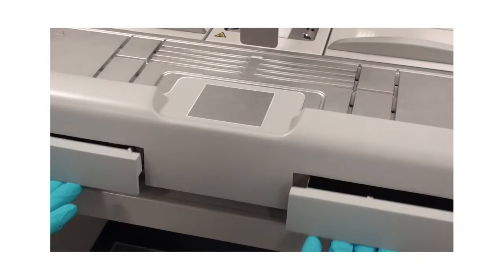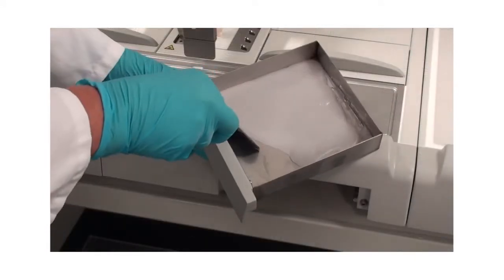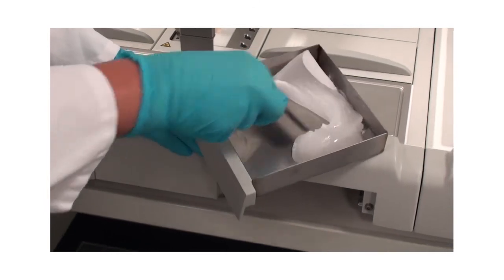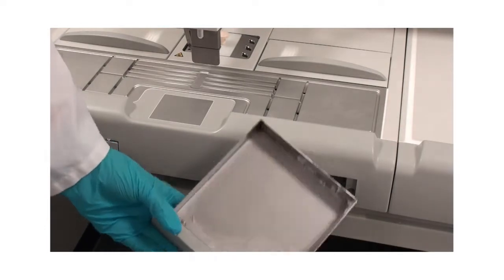To incorporate excess paraffin, two indirectly heated paraffin collecting trays are located under the working surface that can be removed for emptying and disposal. Please do not reuse the paraffin.